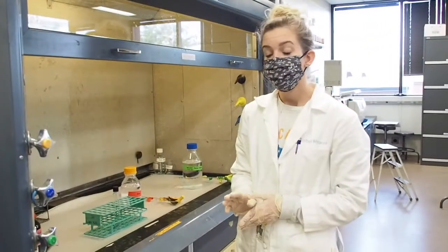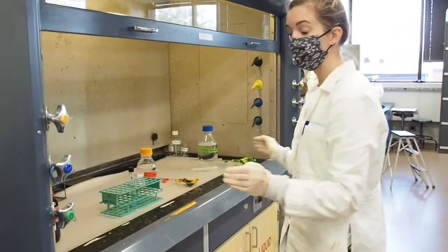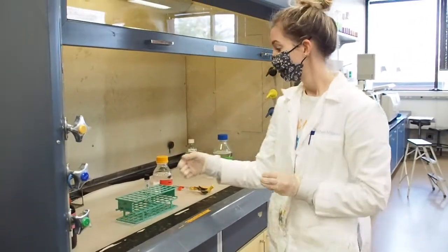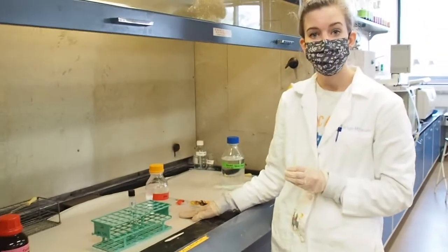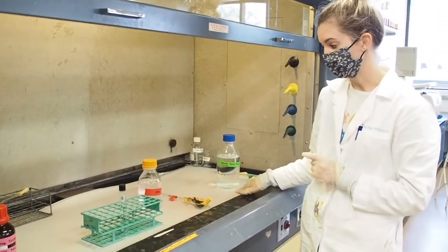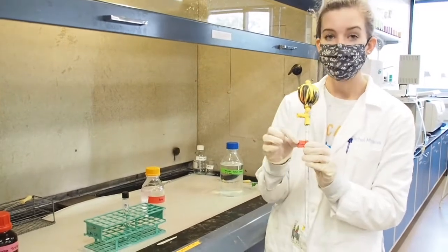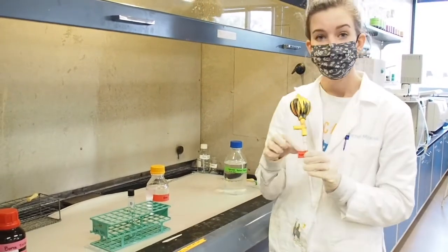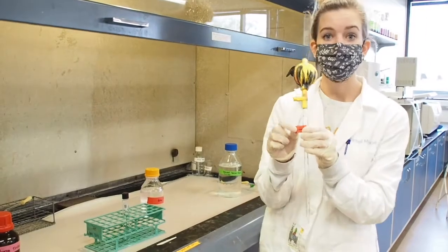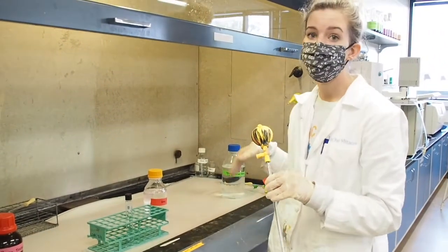So now that my tube is cooled with my sample in it, I'm going to bring it back over to the hood where we did the boron trifluoride, and I'm going to add 7 milliliters of my hexane and 7 milliliters of the saturated sodium chloride solution. You can see that we have volumetric pipettes that have the same exact color and tell you exactly what these need to be used for. So don't interchange them, because then you'll contaminate our solutions.